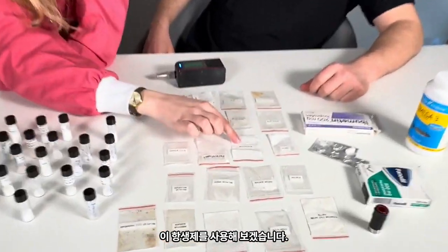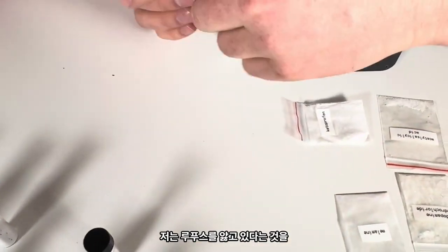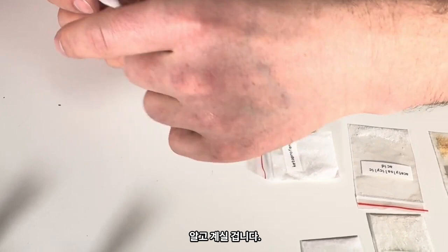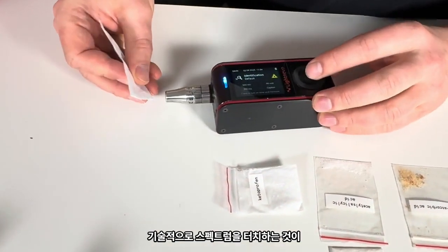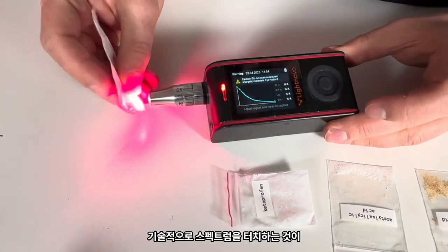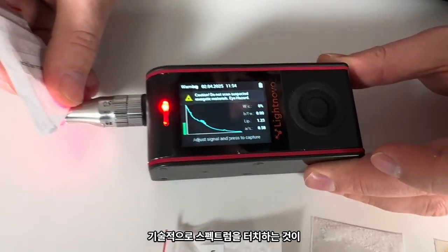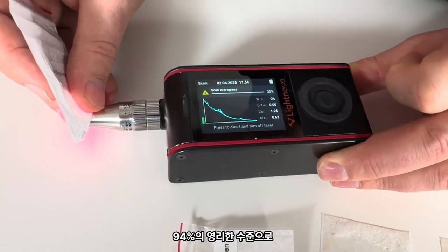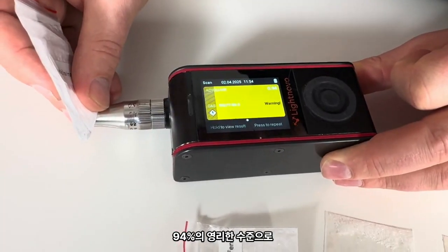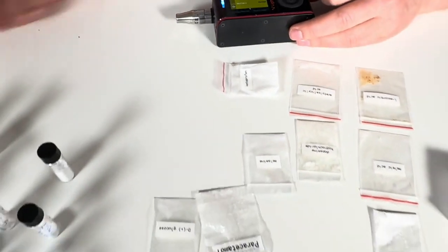So let's do this antibiotic stuff. Okay. It's aciclovir. I guess, you know, I have herpes. I think this is a drug that I sometimes need. So we touch that. Technically, spectrum is good for identification, but I would probably play a little bit with penetration depth. Aciclovir 94%. Good. Something else.